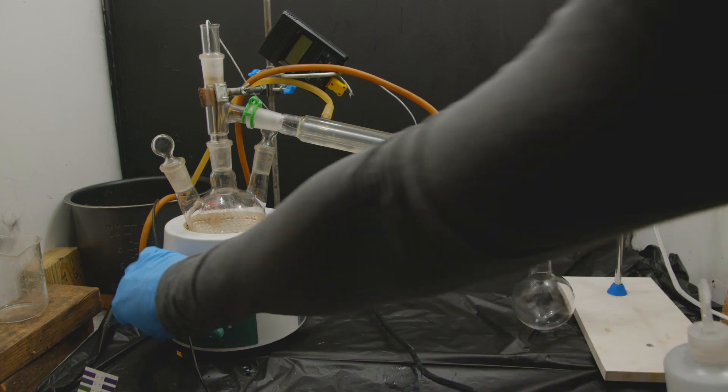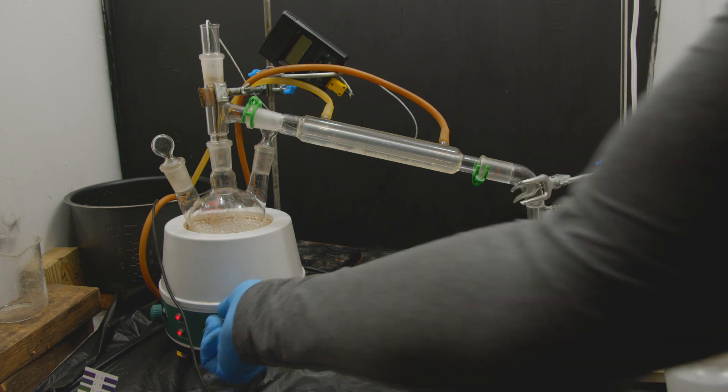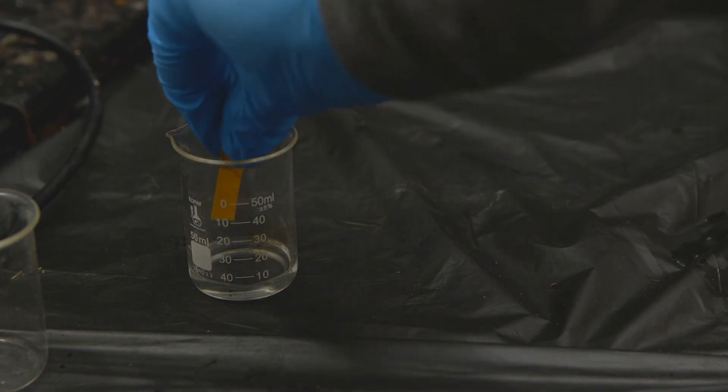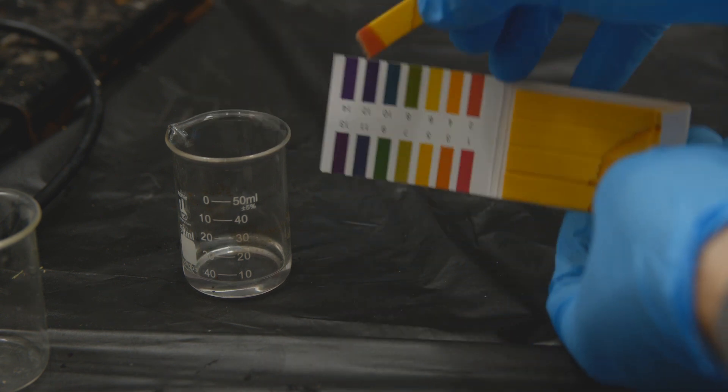So finally to remove the remaining sulfuric acid and sodium sulfate we do another distillation. And after this we're left with water and acetic acid otherwise known as vinegar.